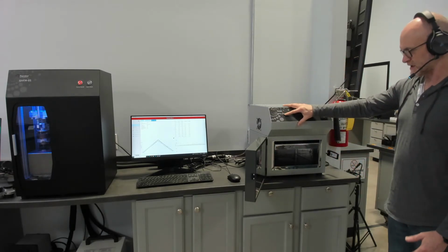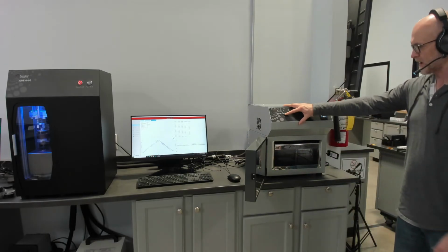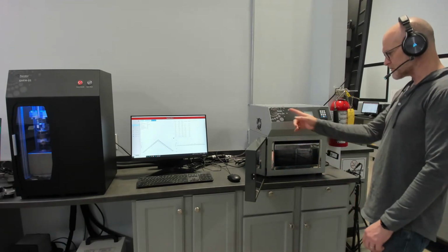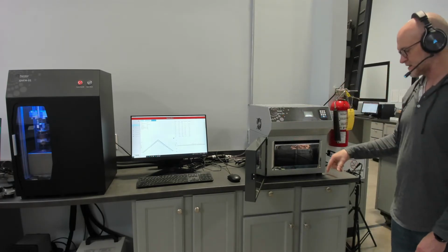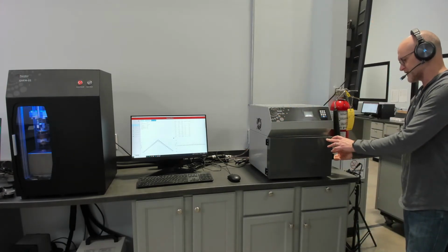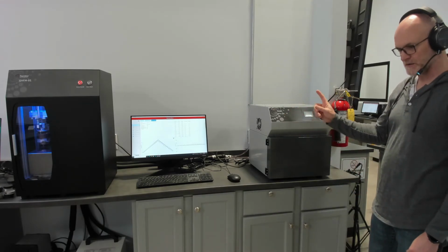This is the HFM100, so that defines the 100 millimeters as its thickness. The plate temperatures on this are -20 to 75 Celsius. There's a high temperature version of the HFM100, which is -30 to 110 Celsius. There's one other size of our HFM series, and it's the HFM50, which is 50 millimeter opening.